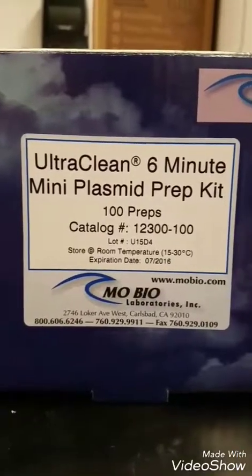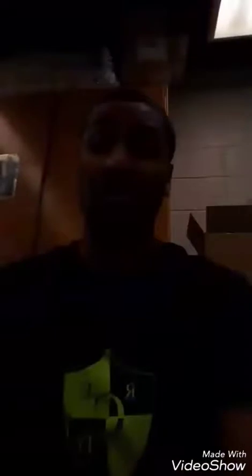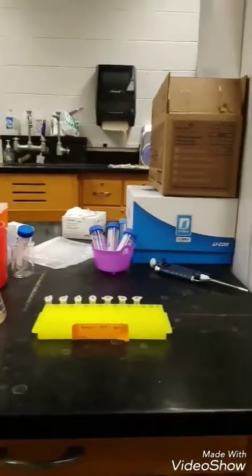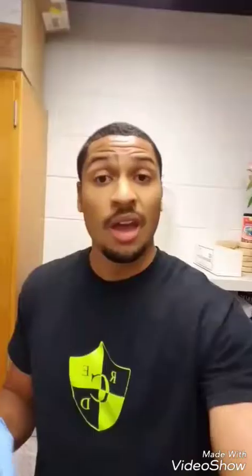Now it may say six-minute mini prep, but when you have 70 preps to do, that turns into like seven hours worth of DNA extraction. And finally, by the end of those seven hours, you go from this to this. And all of that work is just to get about 500 microliters, or half of a milliliter, of my virus's DNA.